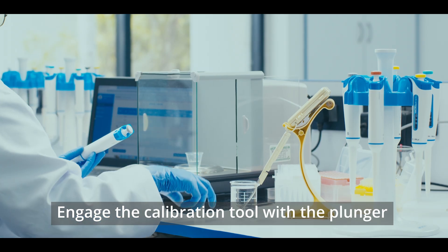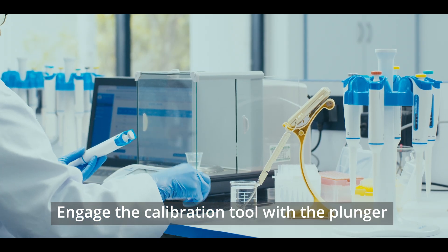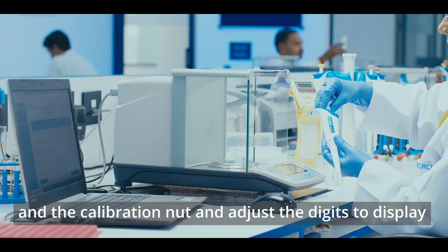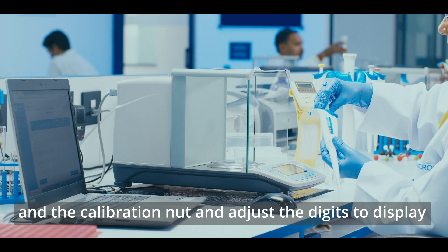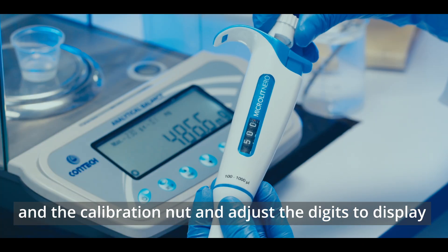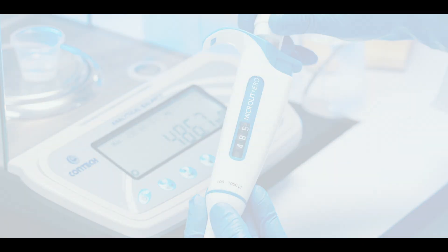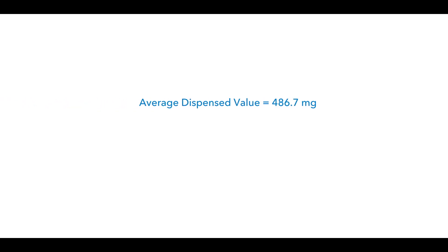Engage the calibration tool with the plunger and the calibration nut, and adjust the digits to display the calculated average dispensed value. In this case, the average dispensed value at 500 µL is 486.7 mg.